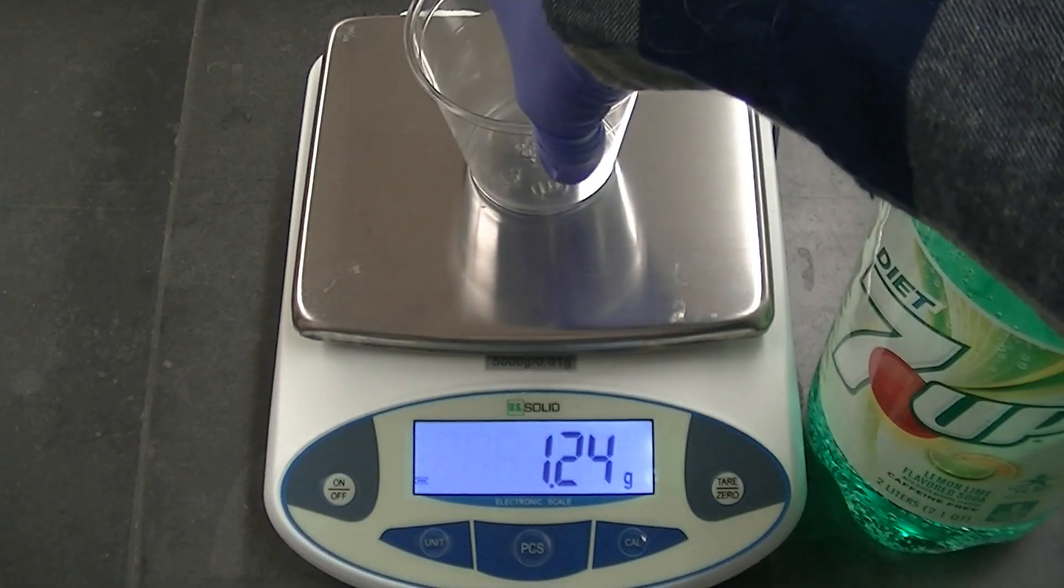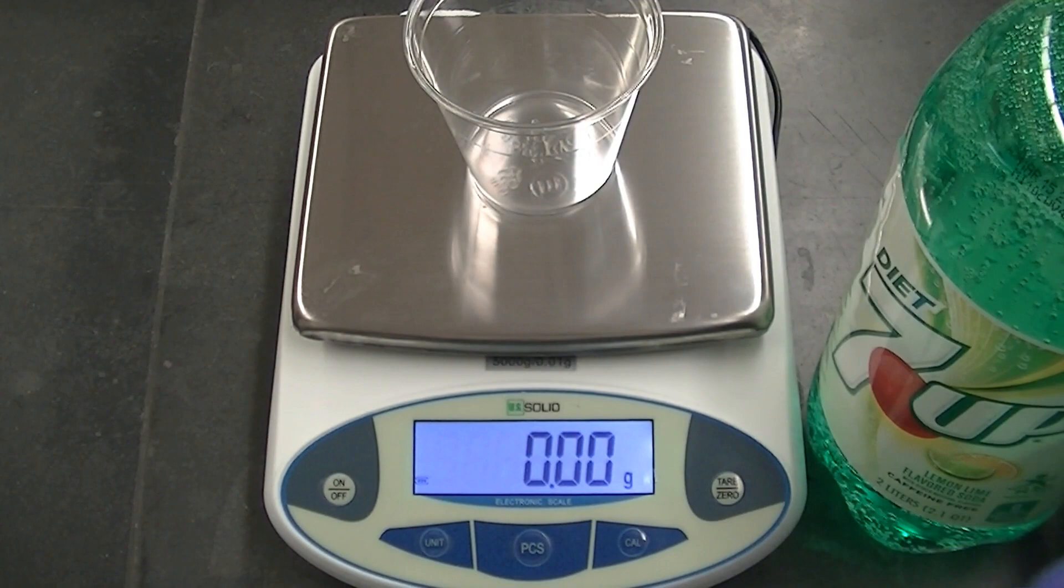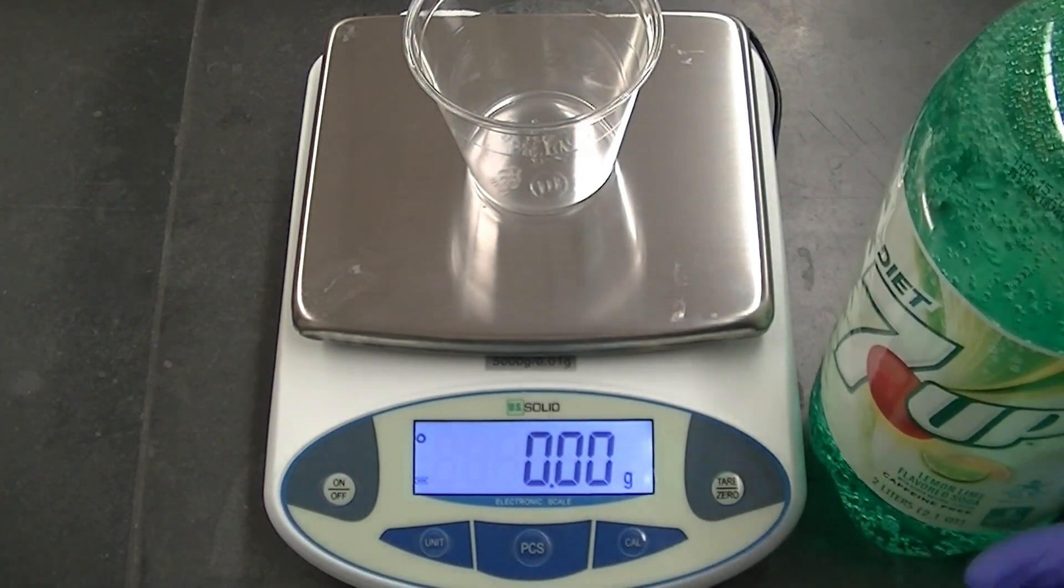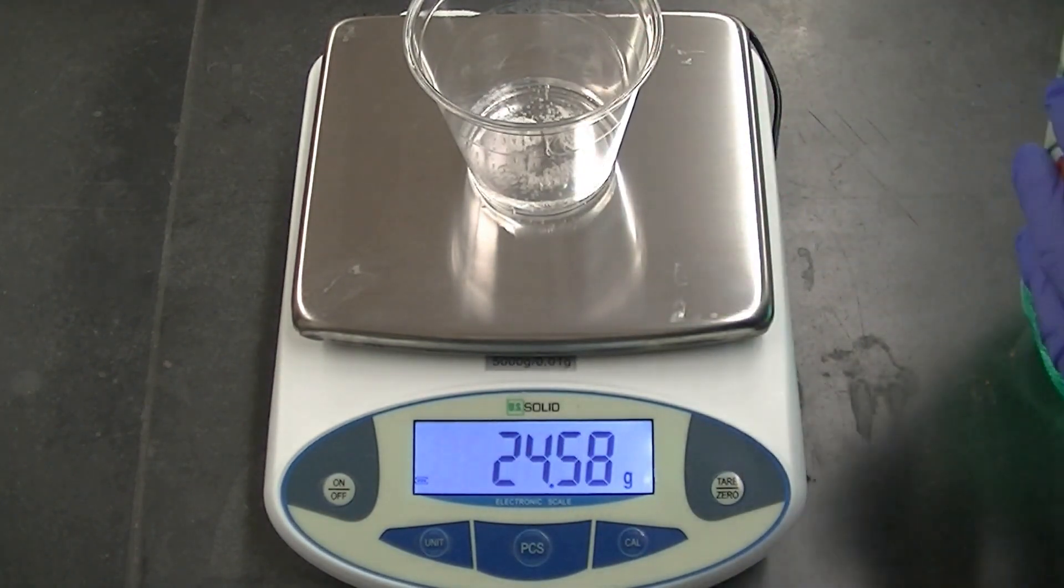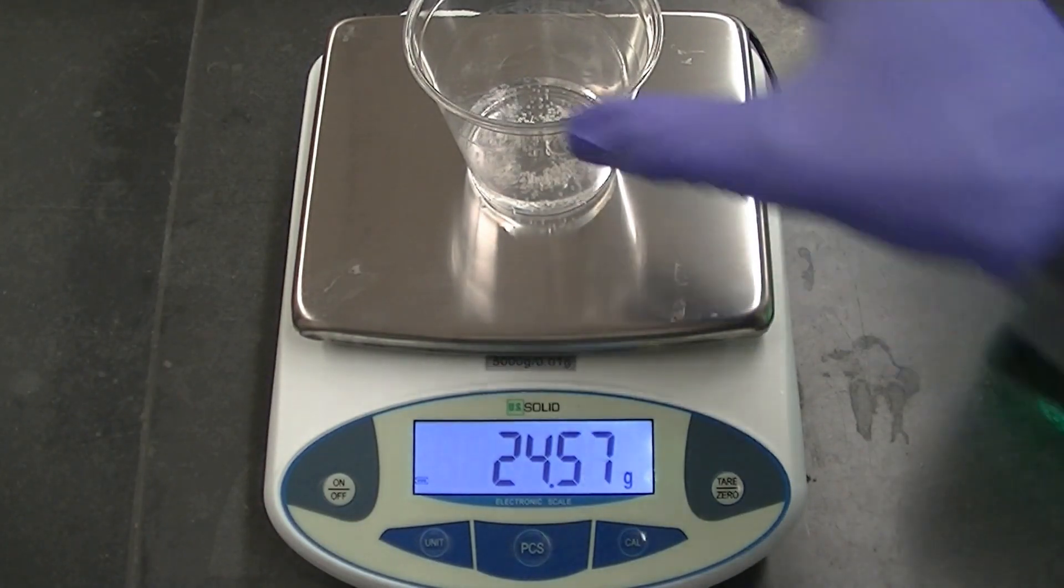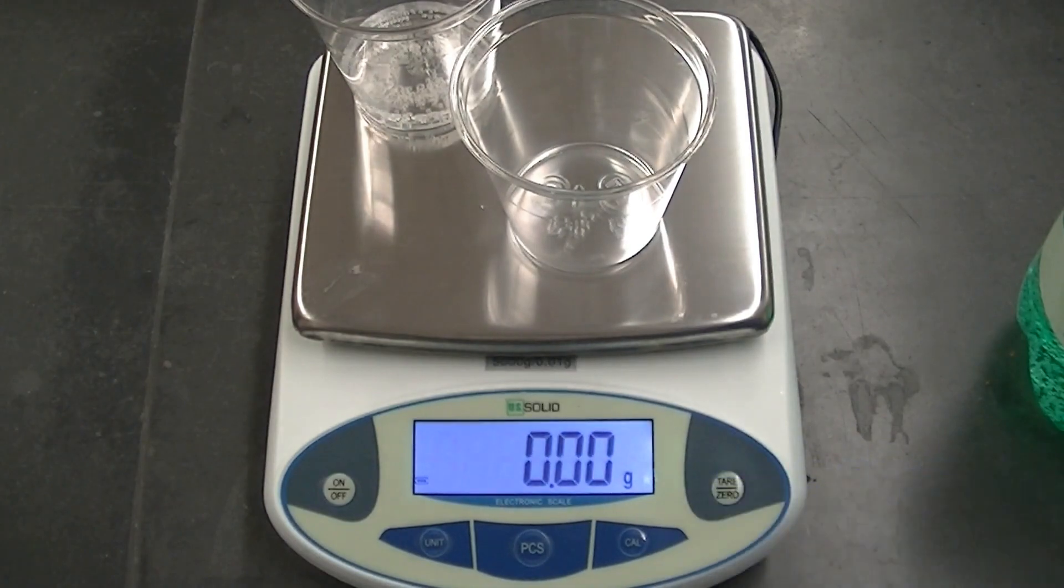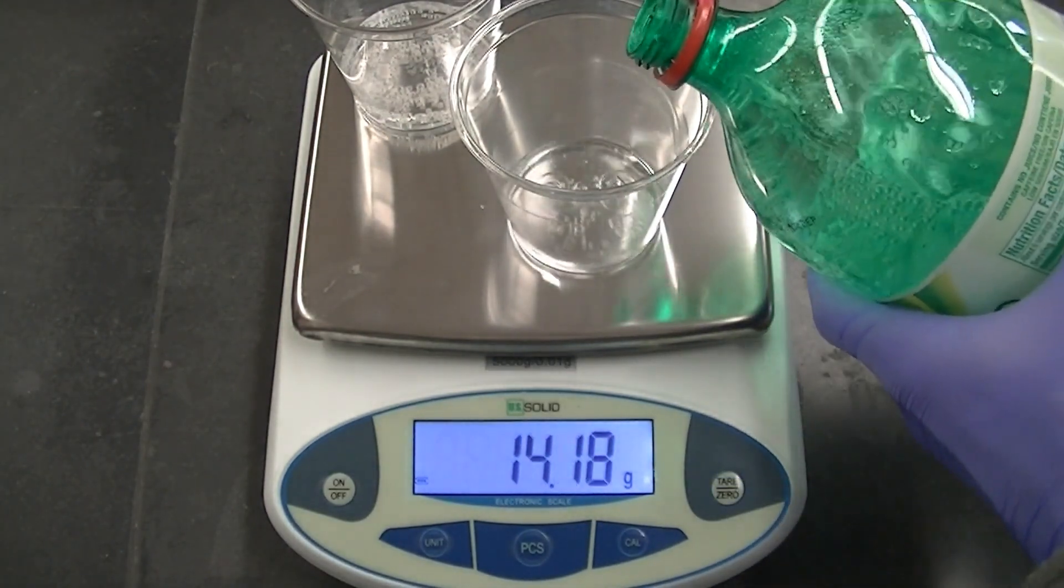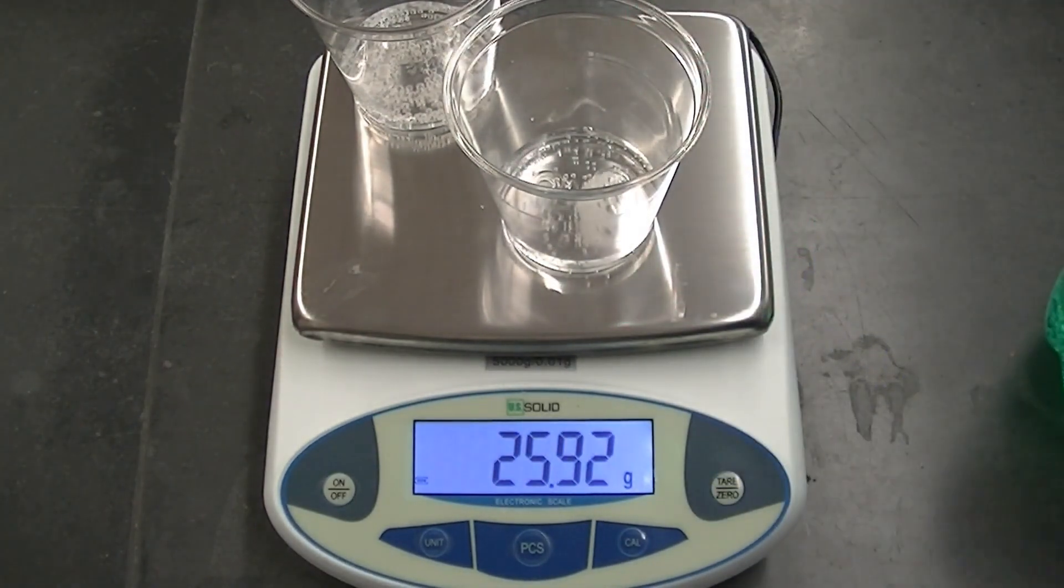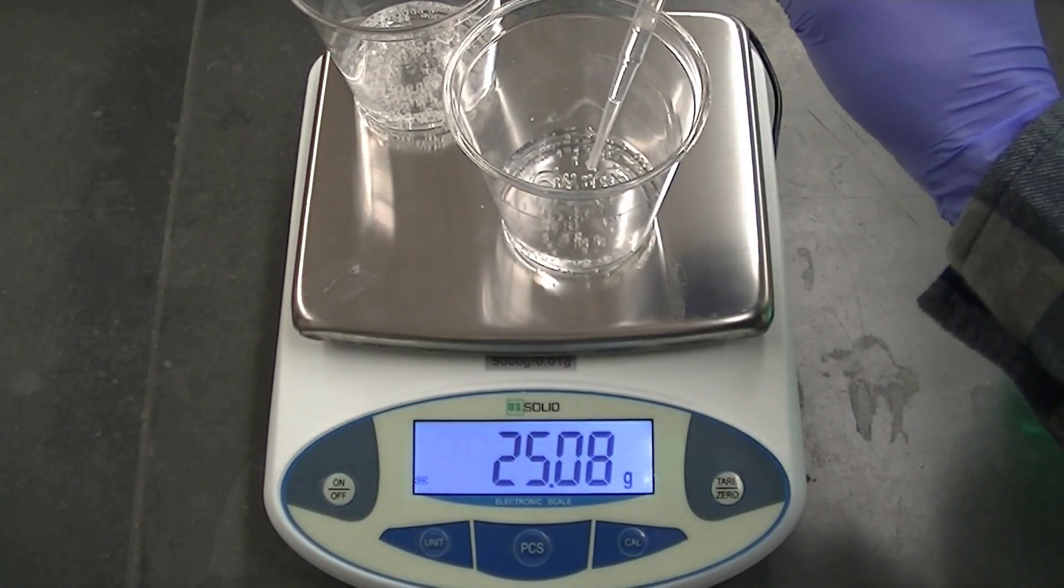Let's weigh out some samples of the diet 7up. It's almost 25 grams, pretty good.